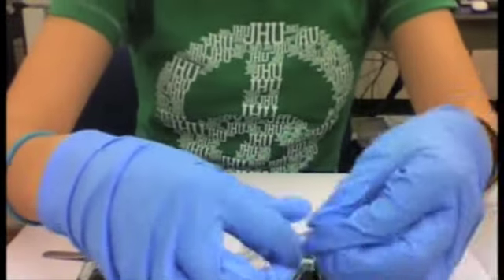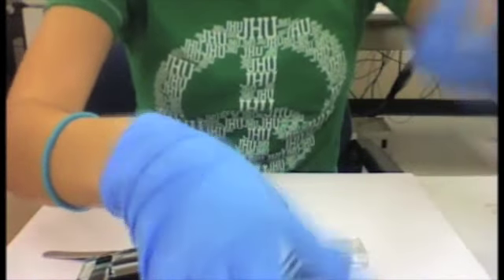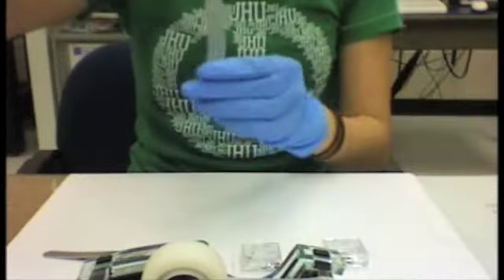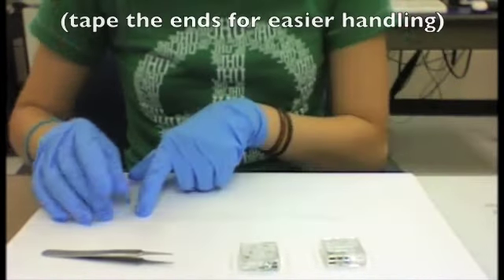The most widely used technique to prepare graphene is the scotch tape technique. You need to wear gloves and goggles for this procedure.